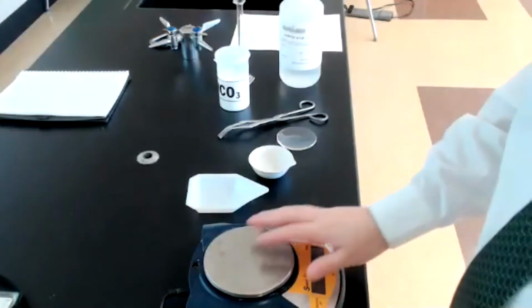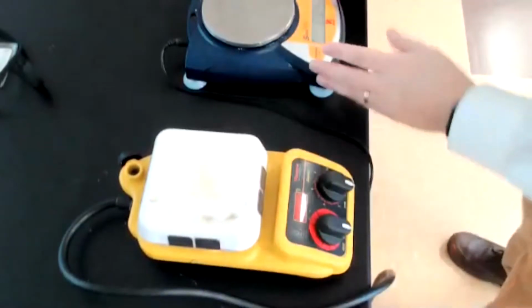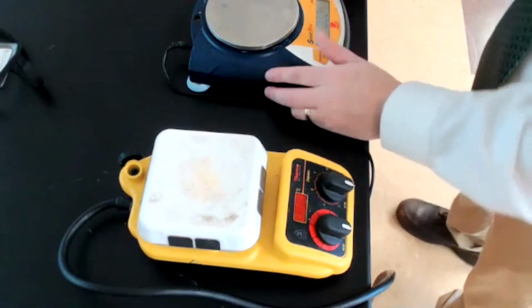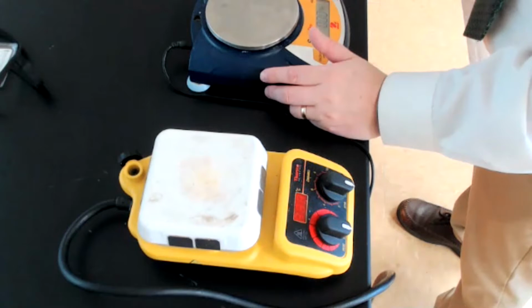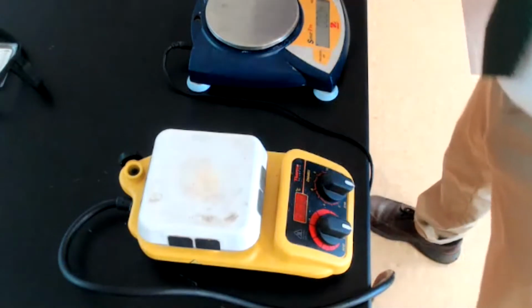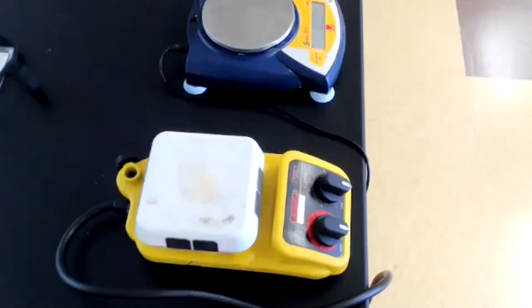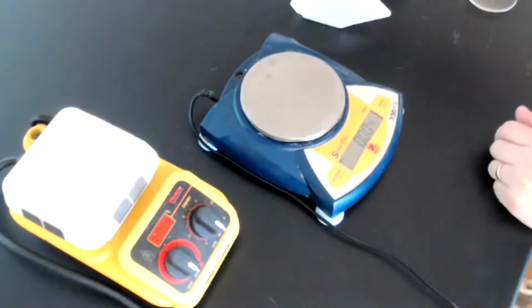Now, up here, I just want to point out a few things. So this is our hot plate that we're going to be using to perform the lab here. This is our balance, which we're going to be using to weigh out our material. We have our weighing dish. We have our evaporating dish, which we'll use later on. We have our watch glass. We have our crucible tongs, which is what we're going to use to move around our hot glassware. And we have our solution and our sodium bicarbonate powder. Okay, let's go ahead and get started.